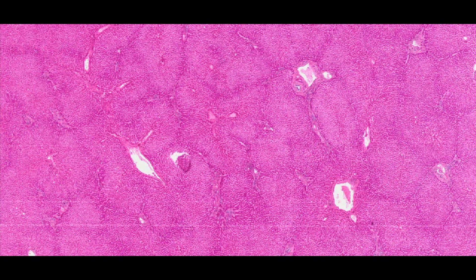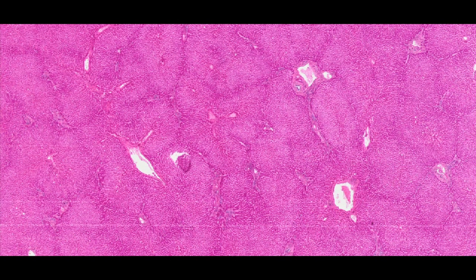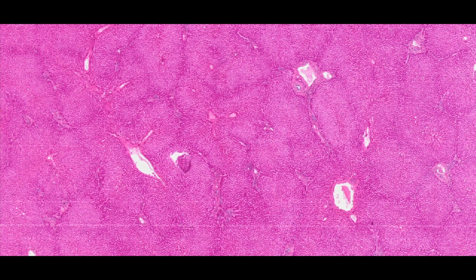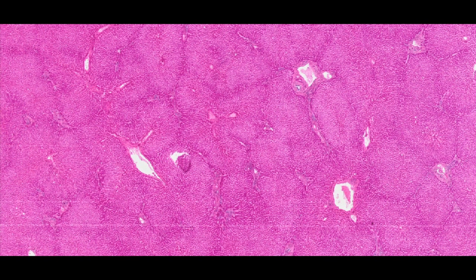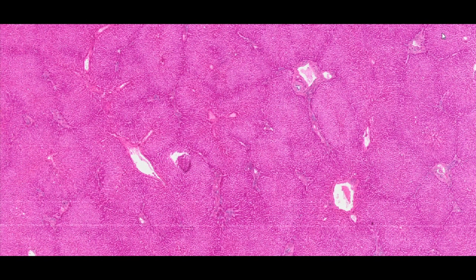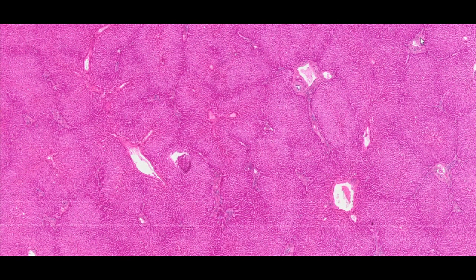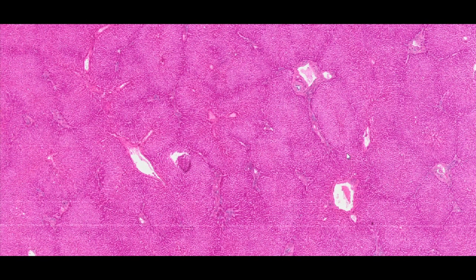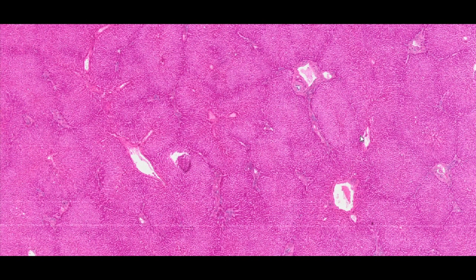Human liver, H&E staining. The liver, which is the largest gland in the body, is covered by a connective tissue layer called Glisson's capsule, from which septa extend deep into the organ, dividing it into classical anatomical lobules, in the shape of a prism in some animals.